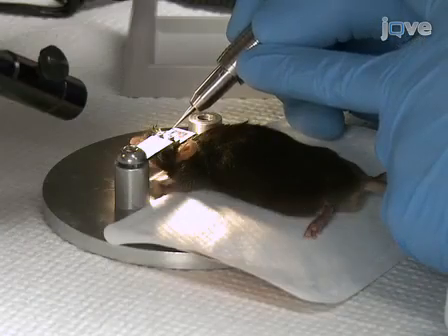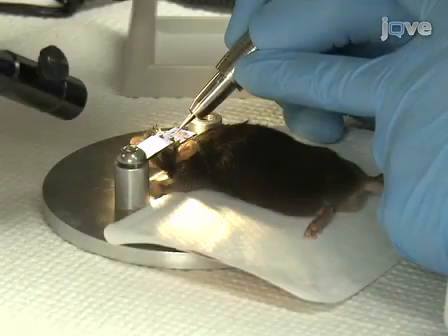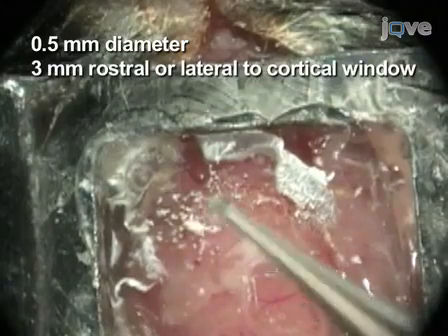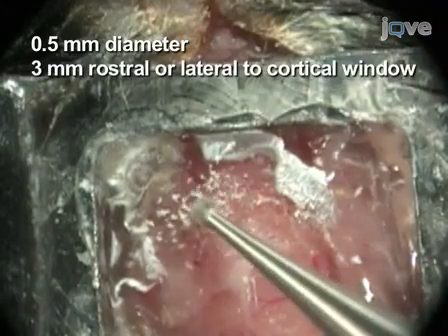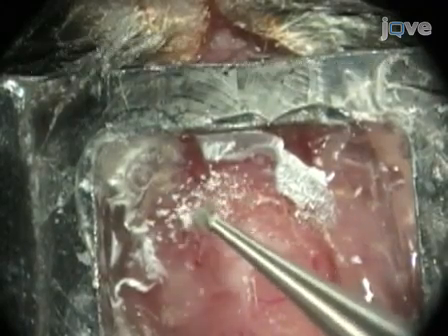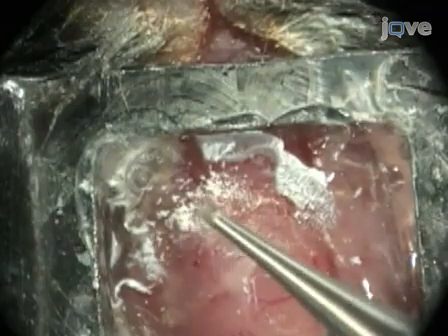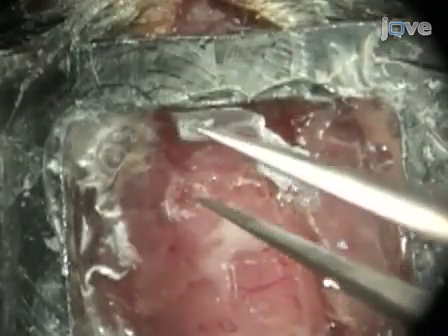Using a drill bit, perform a small craniotomy 0.5 mm in diameter, either 3 mm rostral or lateral, to the thin skull cortical window where two-photon images have been obtained. To accomplish this, carefully thin the skull. Then use a sharp pair of forceps to remove the thinned layer of bone.